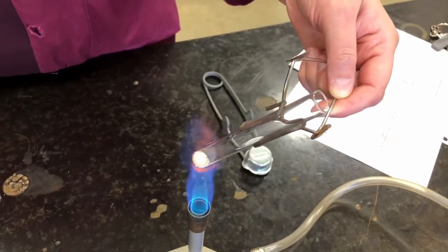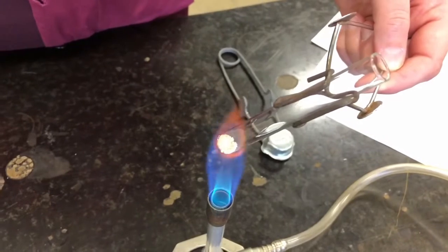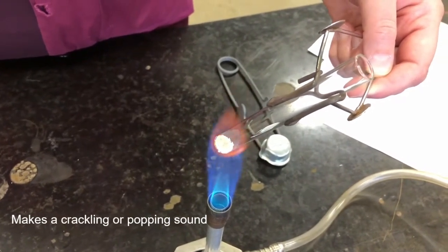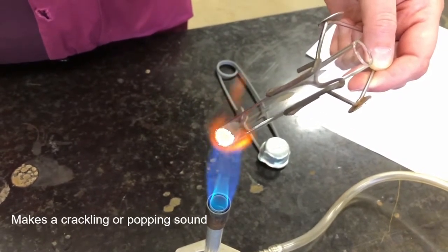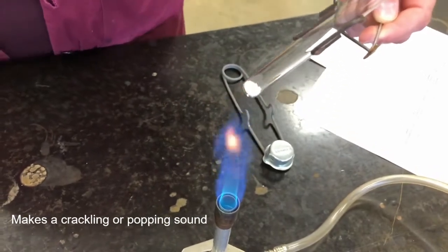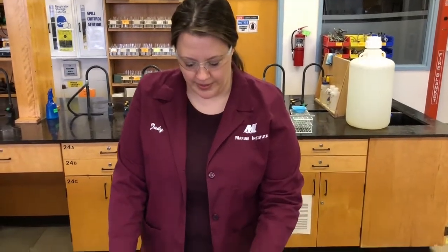Do you hear that? It's kind of like Rice Krispies. So it's making a crackling sound. You may also be able to see some of the crystals jumping around in there. Salt doesn't actually burn, but it does have an effect under heat in that it makes a crackling sound. So that's going to be our observation in this case: when salt is heated, it crackles. So we'll let that one cool.